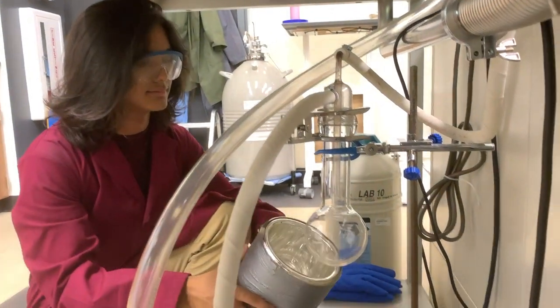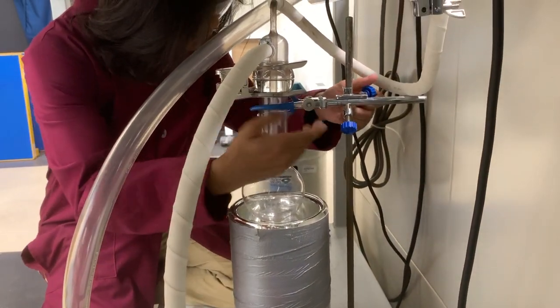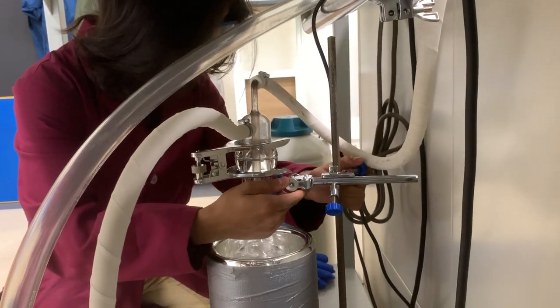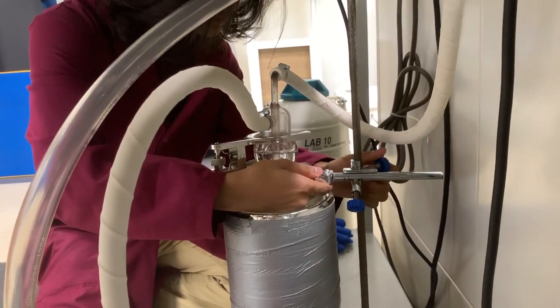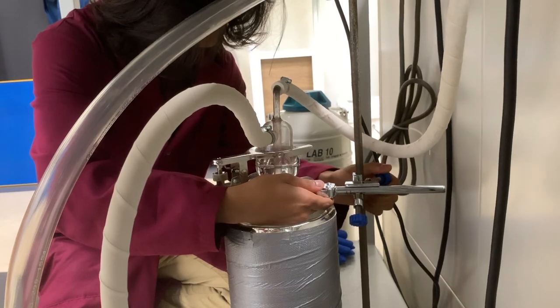At this point, you can place the mirror glass Dewar under the trap. Be careful, as the Dewar is itself under vacuum, kind of like a fancy coffee mug, except this one is super expensive and much more fragile. As you lower the trap into the Dewar, make sure the clamp and the trap itself do not come into contact with the Dewar. You can see Tashrim using his hand to make sure there is a gap between the clamp and the rim of the Dewar.